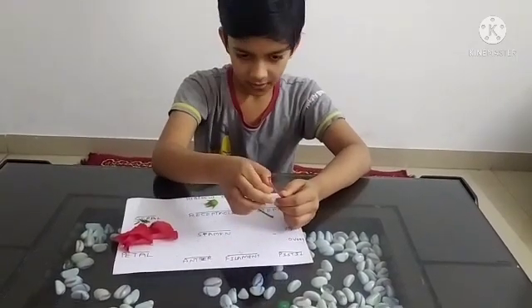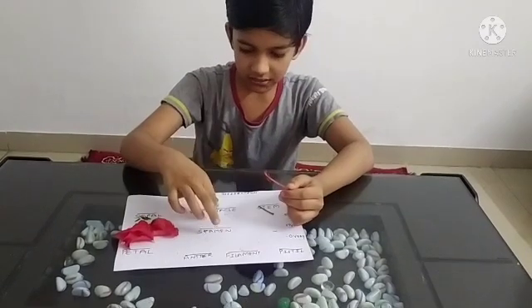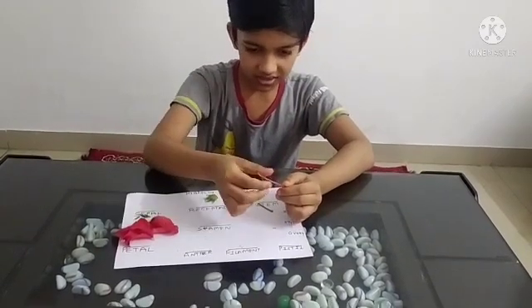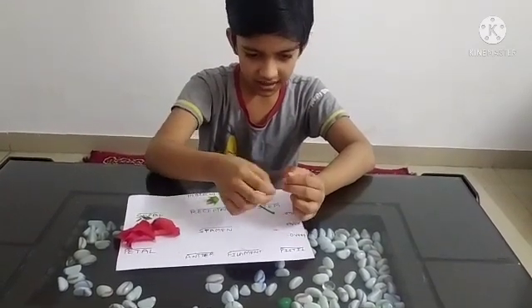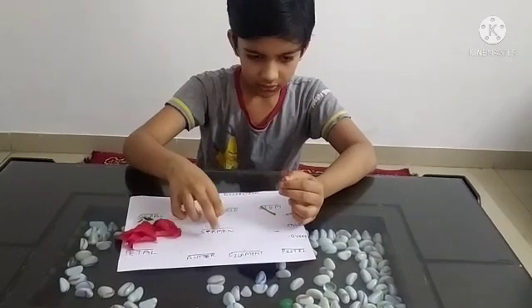Now we will remove the remaining stamens, filaments, and anthers.